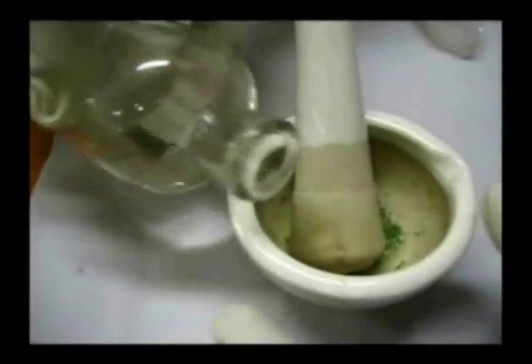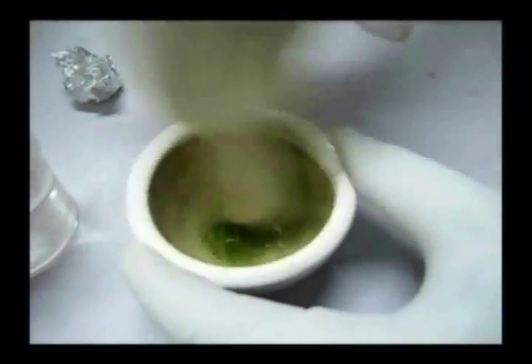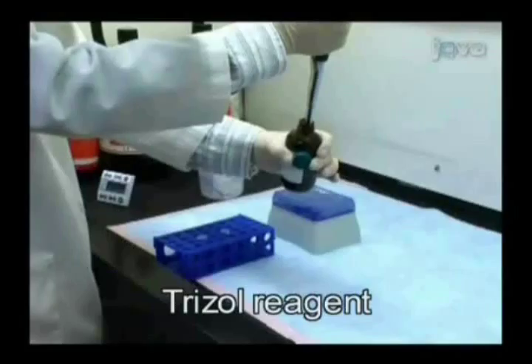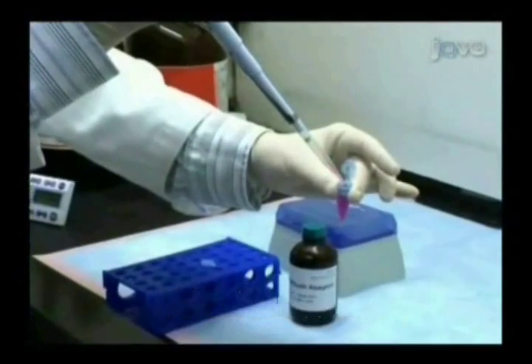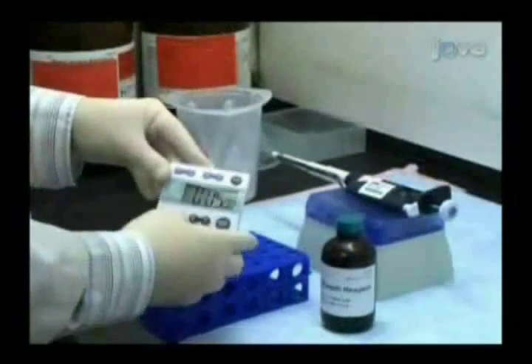The first and foremost step to be done is RNA isolation, for which the leaf is cut into pieces and liquid nitrogen is added to it. After addition of liquid nitrogen, it has to be ground well. Later it has to be transferred into an Eppendorf tube and then trizol reagent is added to it. After addition of trizol reagent, it has to be incubated for about 5 minutes at room temperature.